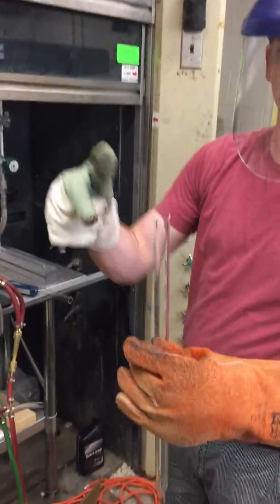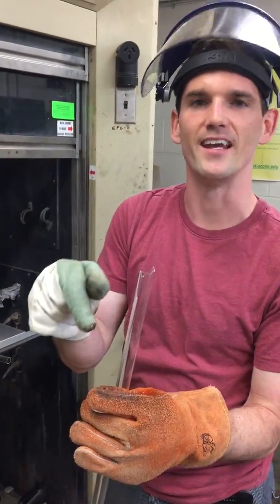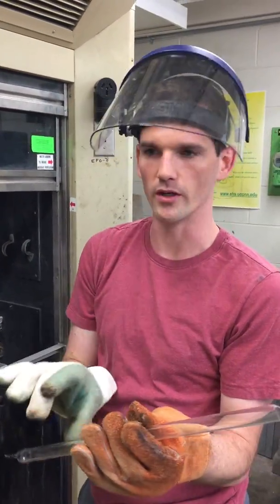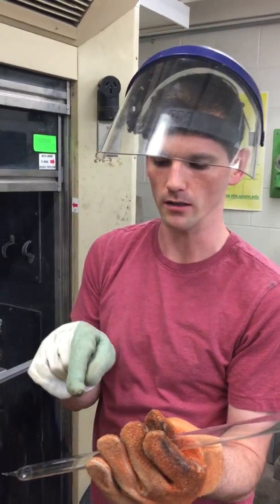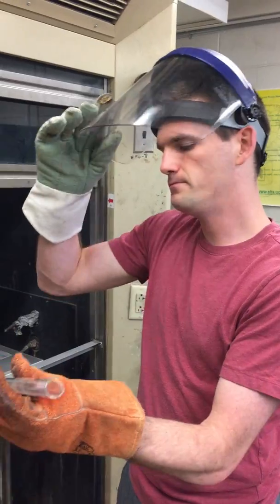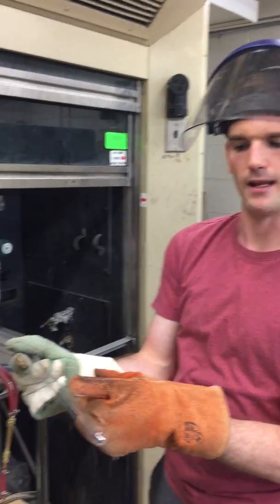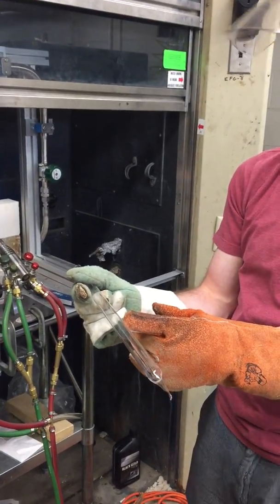At this point, we'll take your samples, put them inside, maybe put a little piece of titanium on the inside. The whole point of this process is to make sure that your samples don't get oxidized when you heat them in a furnace. So put your samples in, titanium in, and we're going to start to neck down the other side of the tube.